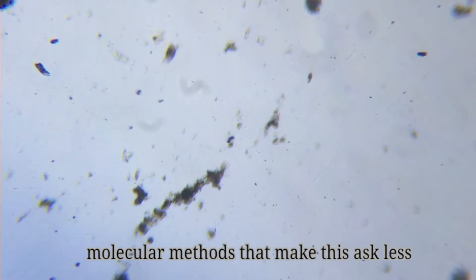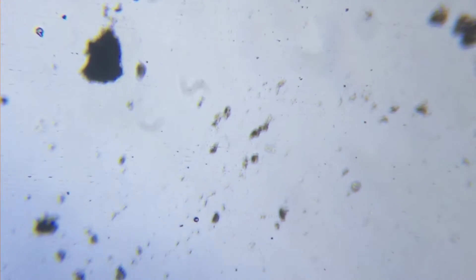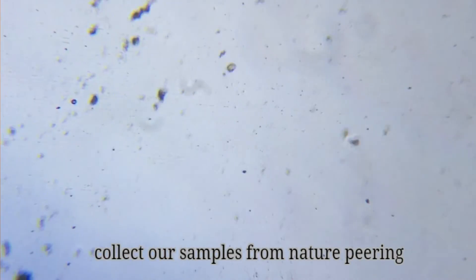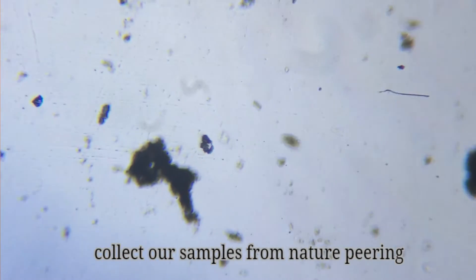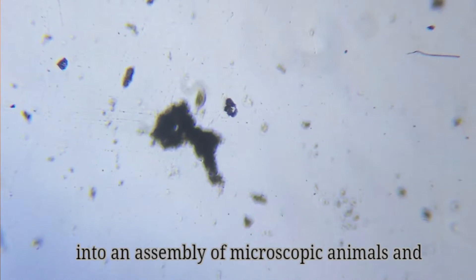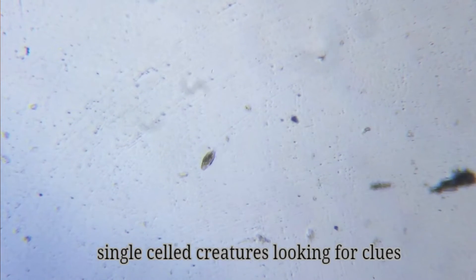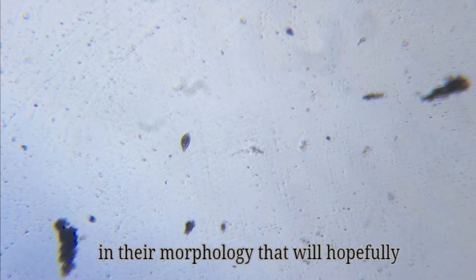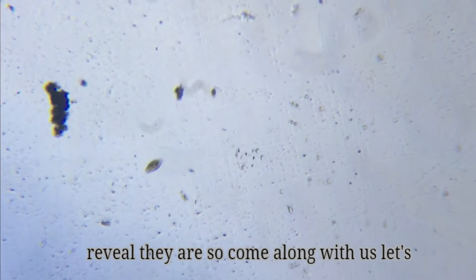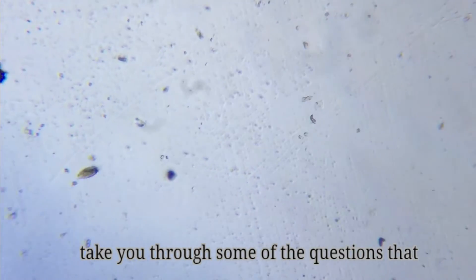And still you can't be sure it even holds the answer, as we'll talk about later. Scientists have devised a number of molecular methods that make this task less daunting, but we do things the old-fashioned way — we just look at the organisms. We collect our samples from nature, peering into an assembly of microscopic animals and single-celled creatures, looking for clues in their morphology that will hopefully reveal what they are.